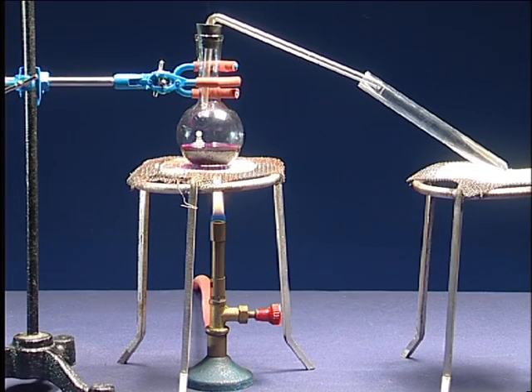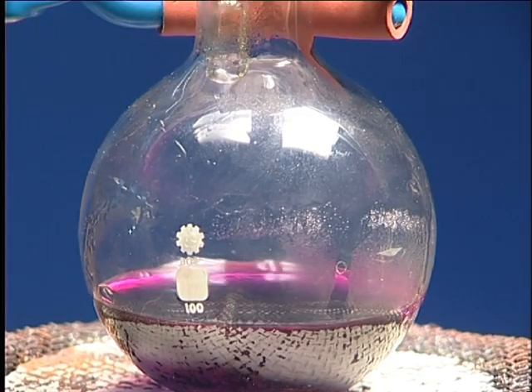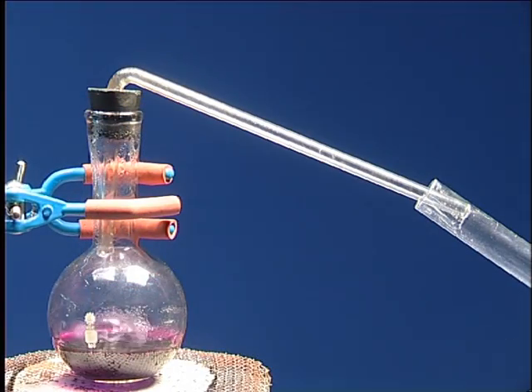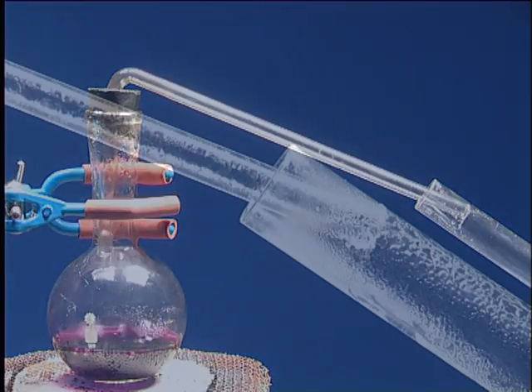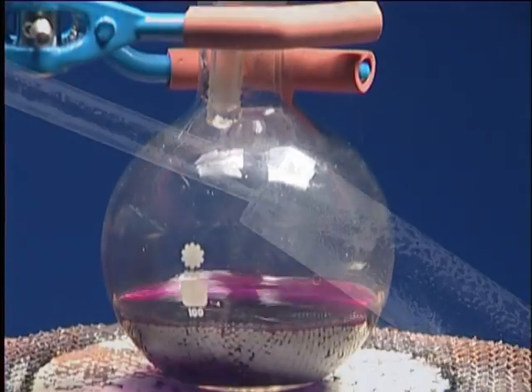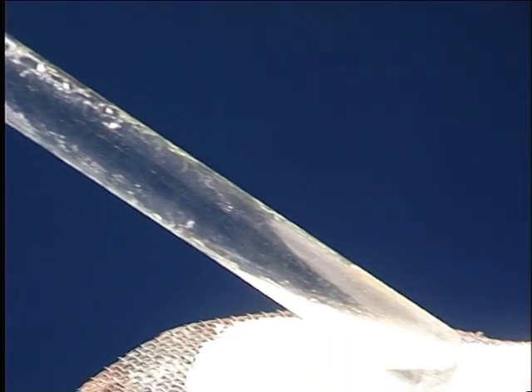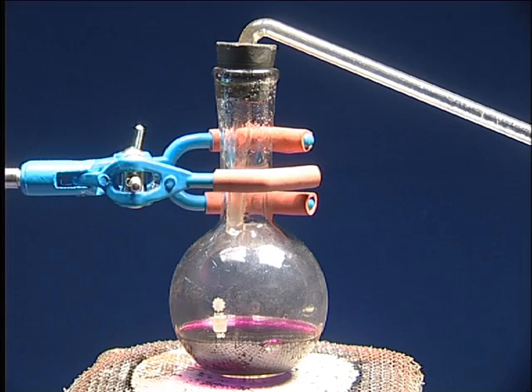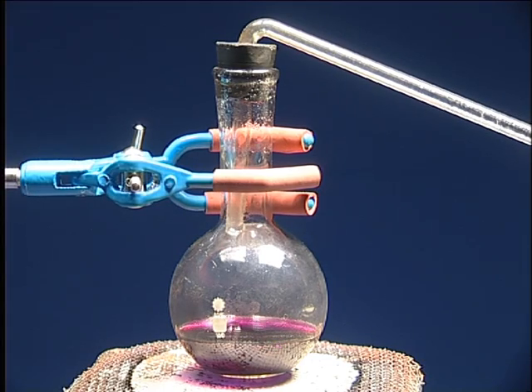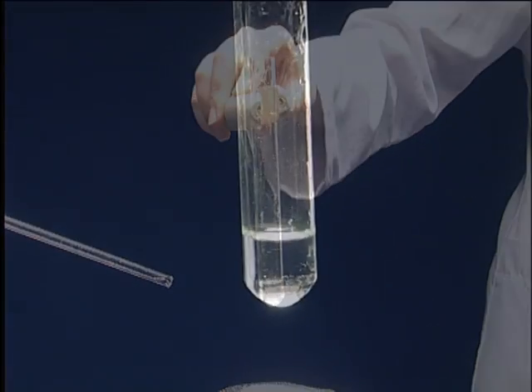Heat the potassium permanganate solution. Vapor coming from the boiling liquid goes into the test tube. Compare the color of substance left in the flask with its first appearance. Observe the color of liquid that goes into the test tube. This process is called distillation.